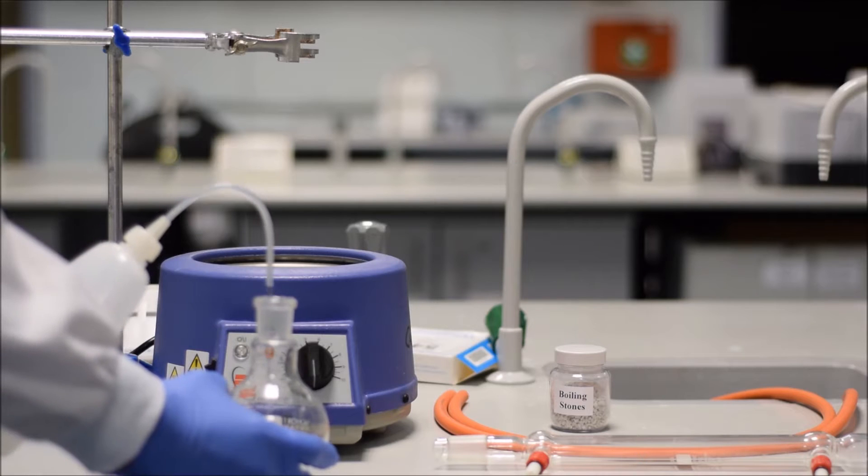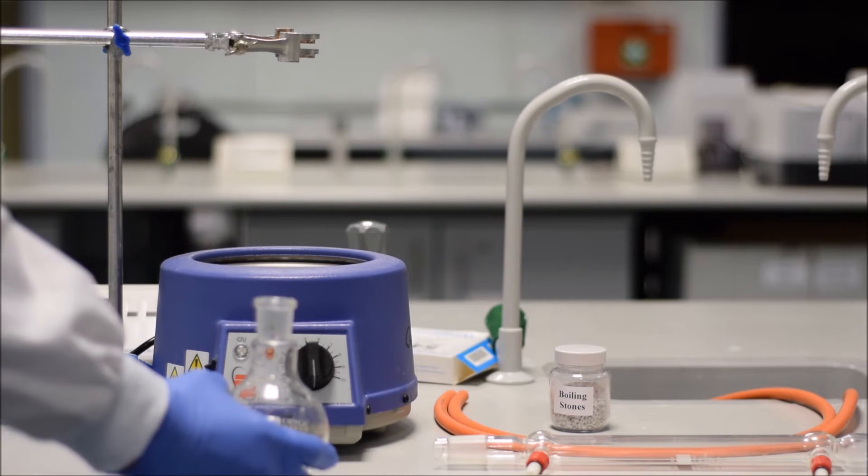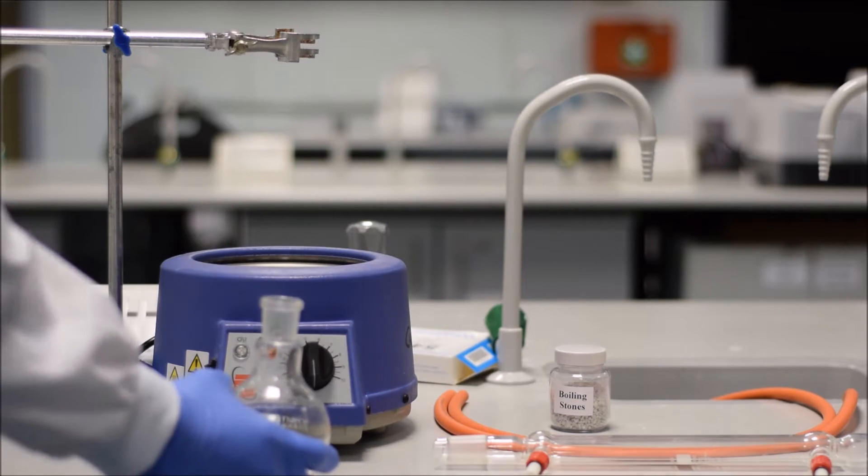So to do that, we put our solvent into our flask. Usually you put lots of other ingredients in too, but I just want to demonstrate the concept, so I'm just going to use distilled water. You add in your reagents, and then you want to set it up.